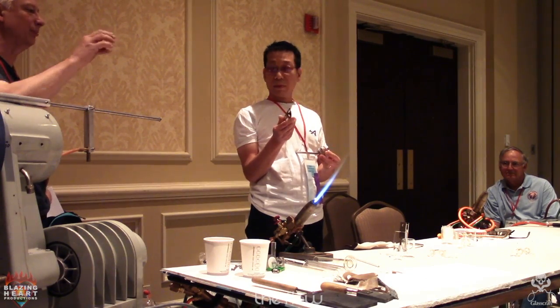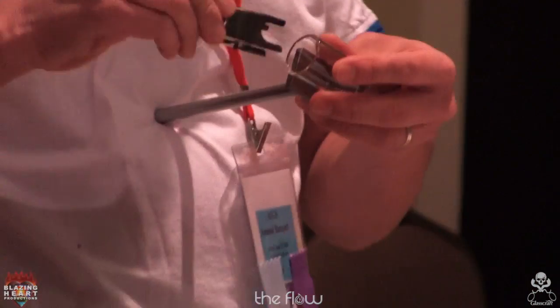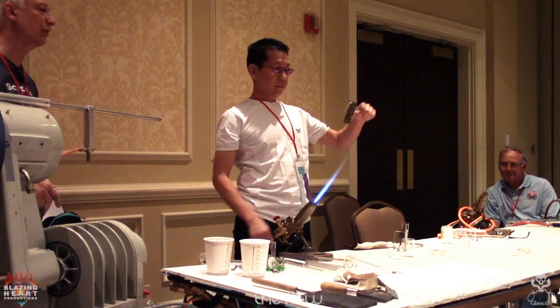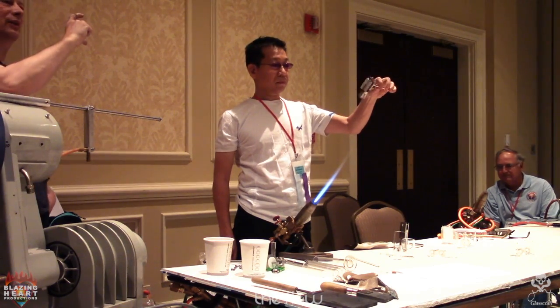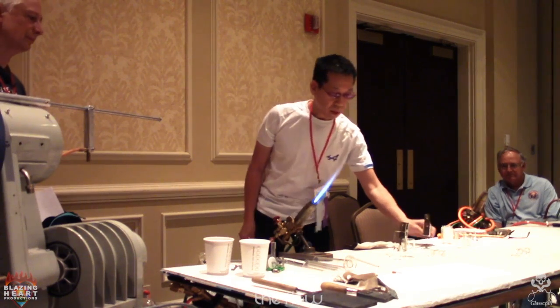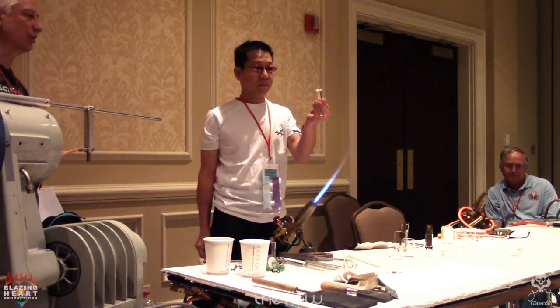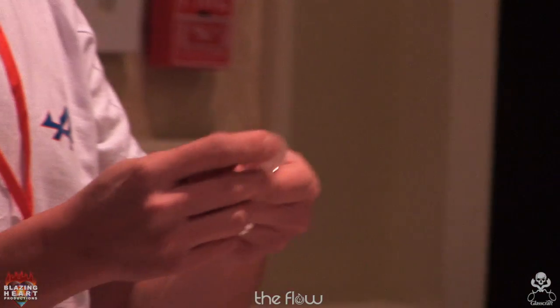It looks like it could be the back end of a Thomas pinch clamp, but the stainless version, not the ones that are brass or painted. So you clip it down, and then you get your 90-degree alignment for rotating in the chuck. You also get the offset length for the arms, so that all the arms are exactly the same height every time. This is the small flange on the side. He's got two versions. He tools up and makes the small flanges, and also a larger version with a larger diameter flange.